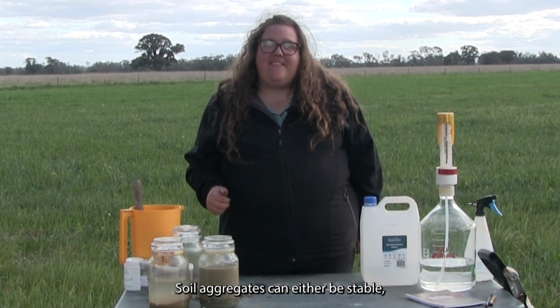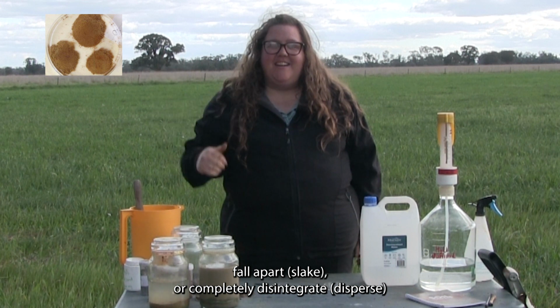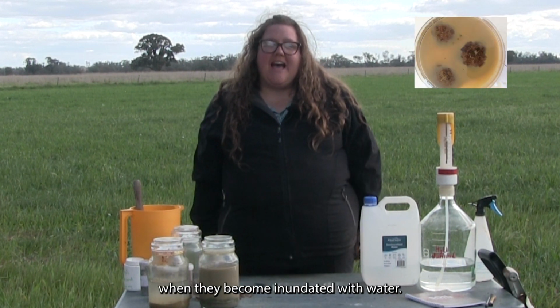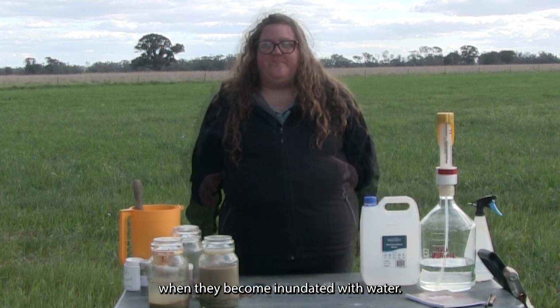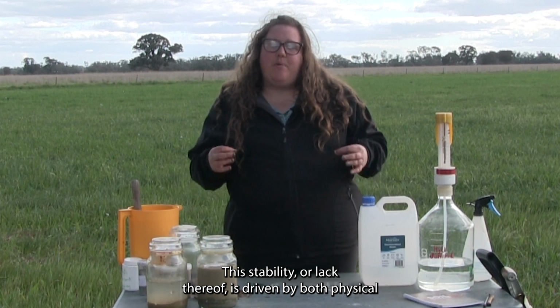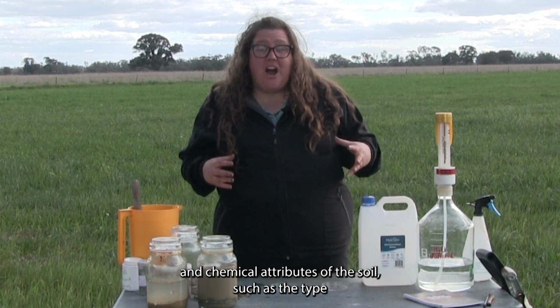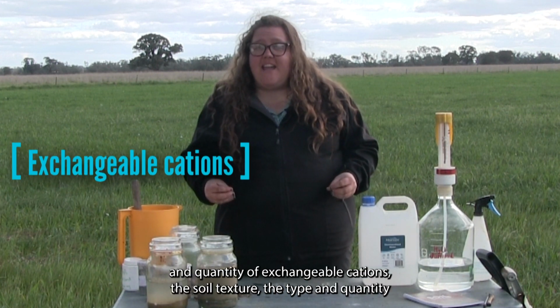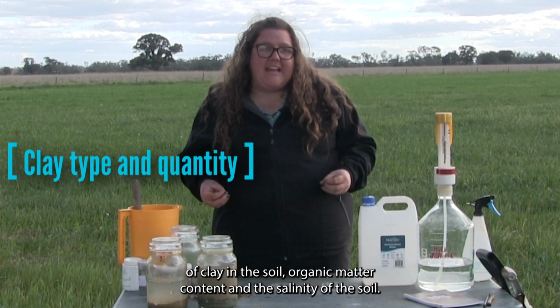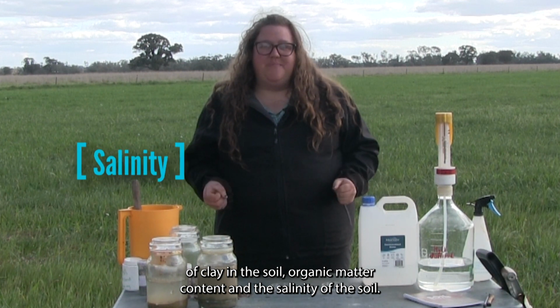Soil aggregates can either be stable, fall apart (slake), or completely disintegrate (disperse) when they become inundated with water. This stability, or lack thereof, is driven by both physical and chemical attributes of the soil, such as the type and quantity of exchangeable cations, the soil texture, the type and quantity of clay in the soil, organic matter content, and the salinity of the soil.